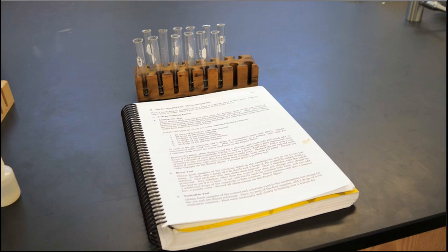Add about 5 more drops of sodium hydroxide to any solution that does not test strongly basic, and recheck the pH and add more sodium hydroxide if necessary until each solution tests strongly basic with pH paper. Record any color changes on the report sheet. And tyrosine will give a positive test.